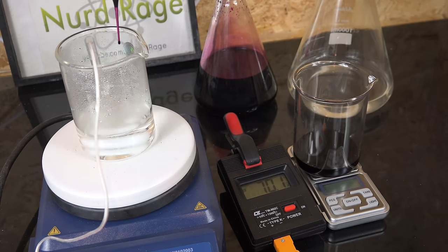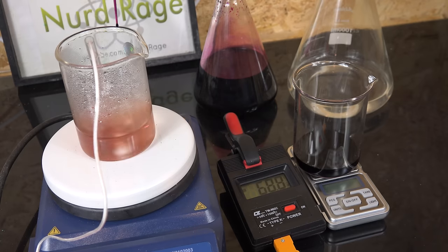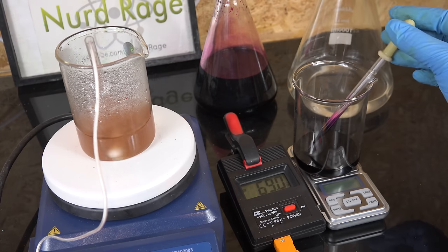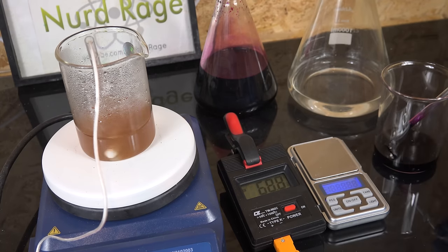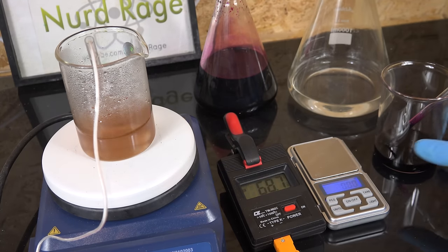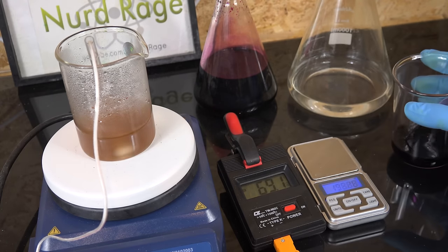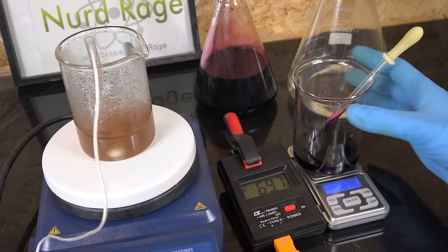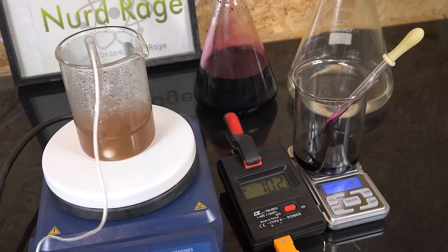Since this is our precision trial we need to go carefully. Add drop by drop of potassium permanganate and make sure the color vanishes before adding the next drop. When the color lingers and doesn't vanish then you know you've reached the endpoint. Record how much potassium permanganate in total we've used. 10g was added directly and an additional 1g was titrated in. I know it seems odd to weigh the whole beaker of titrant and the pipette too. But this is to minimize errors from drops of titrant sticking to the pipette. If we weigh them together then everything is accounted for. And that was our first precision trial.